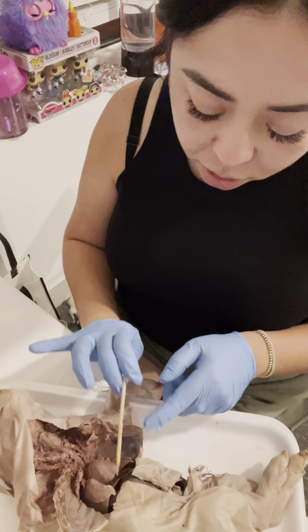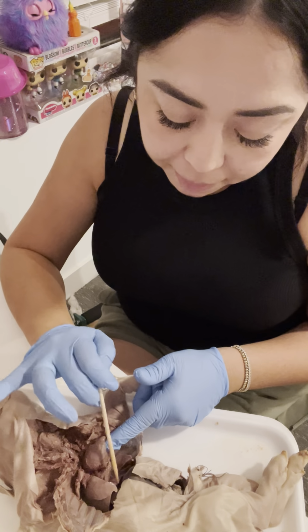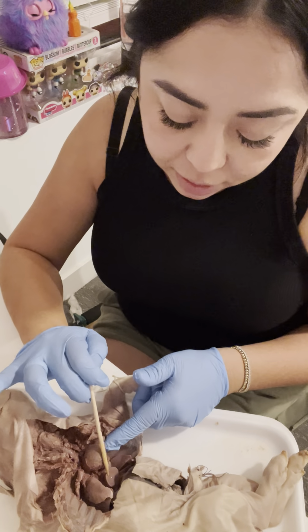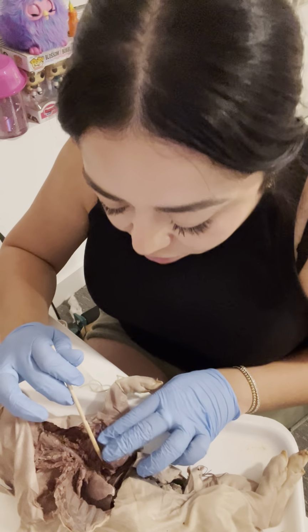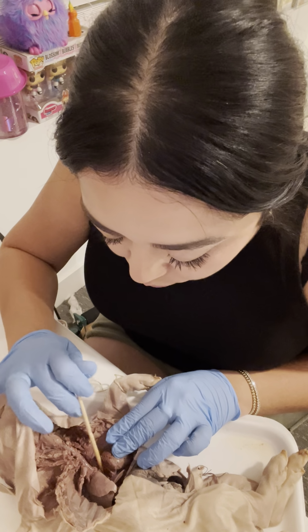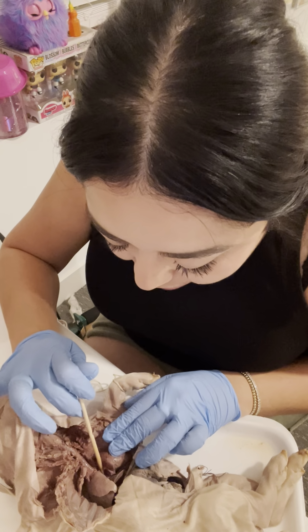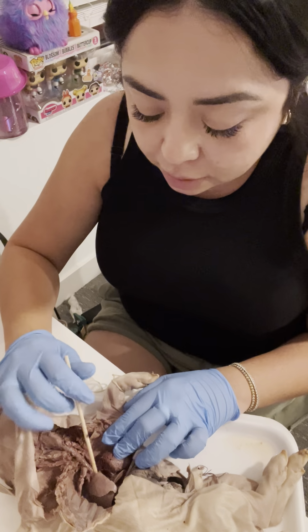And then if I push the heart up, you can see the diaphragm right here. It looks like another lobe and it's floppy. That's our diaphragm here. And then the hilus of the lung, let me move the heart, is right up here. And it moves right down, all the way down past the bronchi. And it's like the root of our lungs.